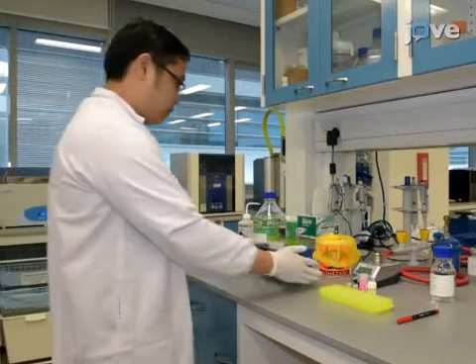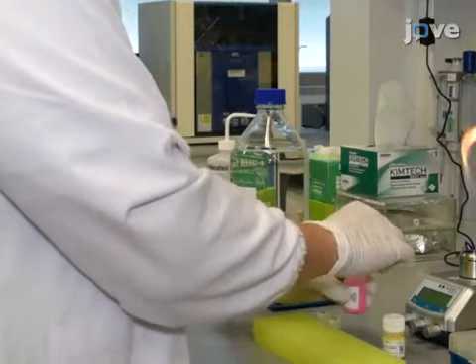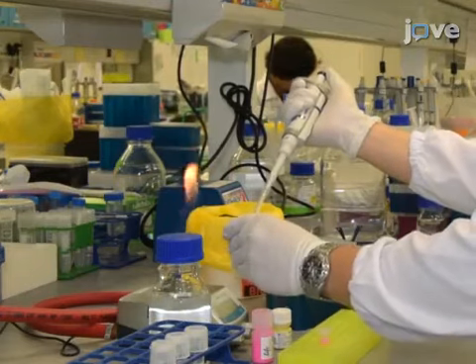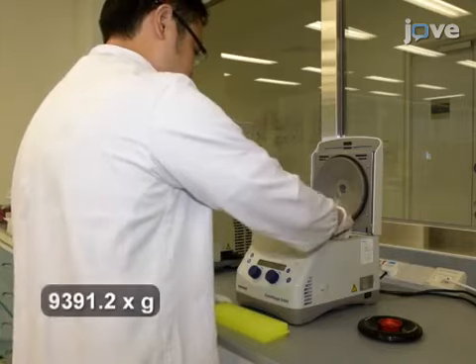After preparing overnight bacterial cultures and supplies and medium for flow cell setup according to the text protocol, aliquot fluorescent microspheres in sterile water into microcentrifuge tubes. To remove the sodium azide, spin down the tubes for 5 minutes.